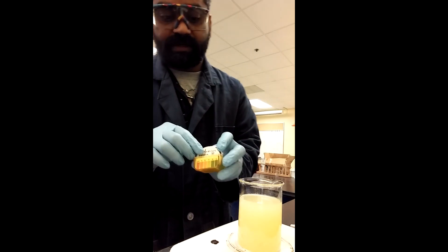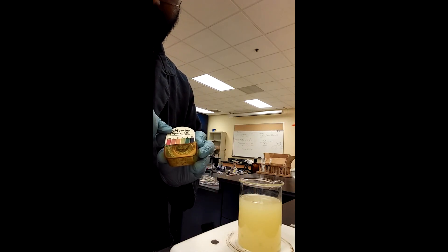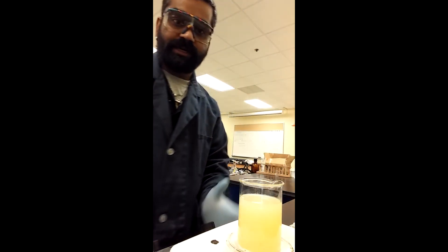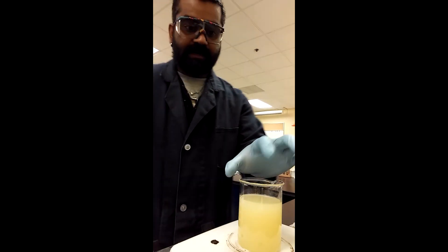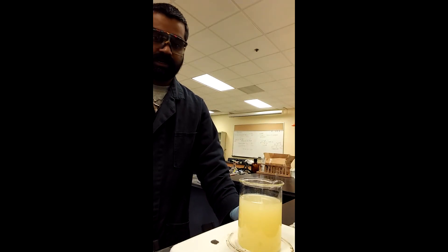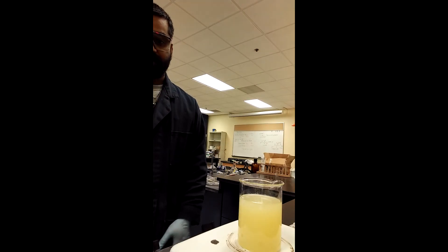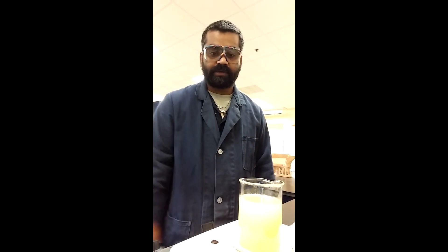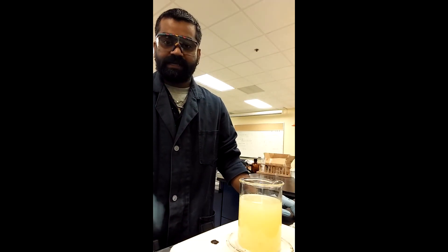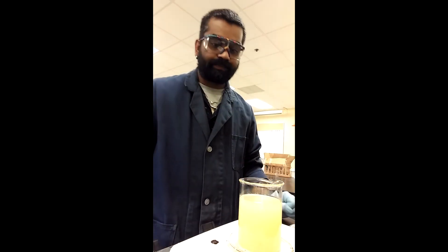We will handle concentrated acids, and you'll need a stir plate. You can see the beaker containing the lemon juice — I've taken about 115 grams. The actual procedure calls for about 450 grams, but that's if you want to make a lot of citric acid. I want to cut down the amount of waste in the process and I don't want students using a lot of lemon juice. So for the purpose of our lab I cut it down to about 115 grams. I put a stir bar already in it.